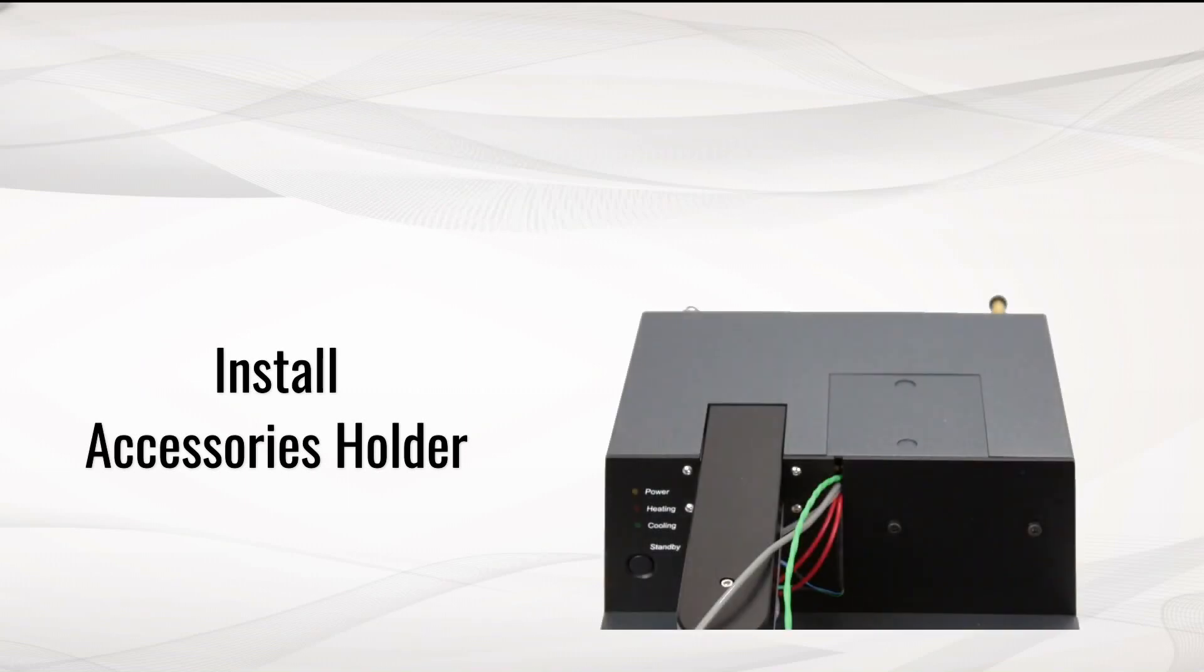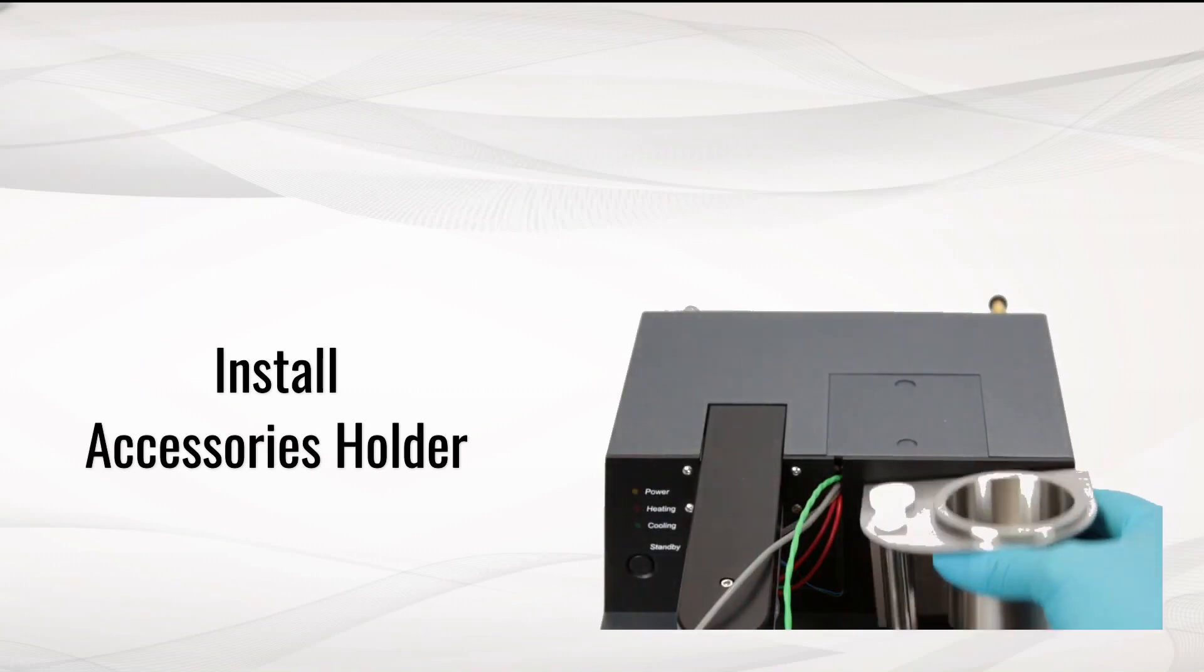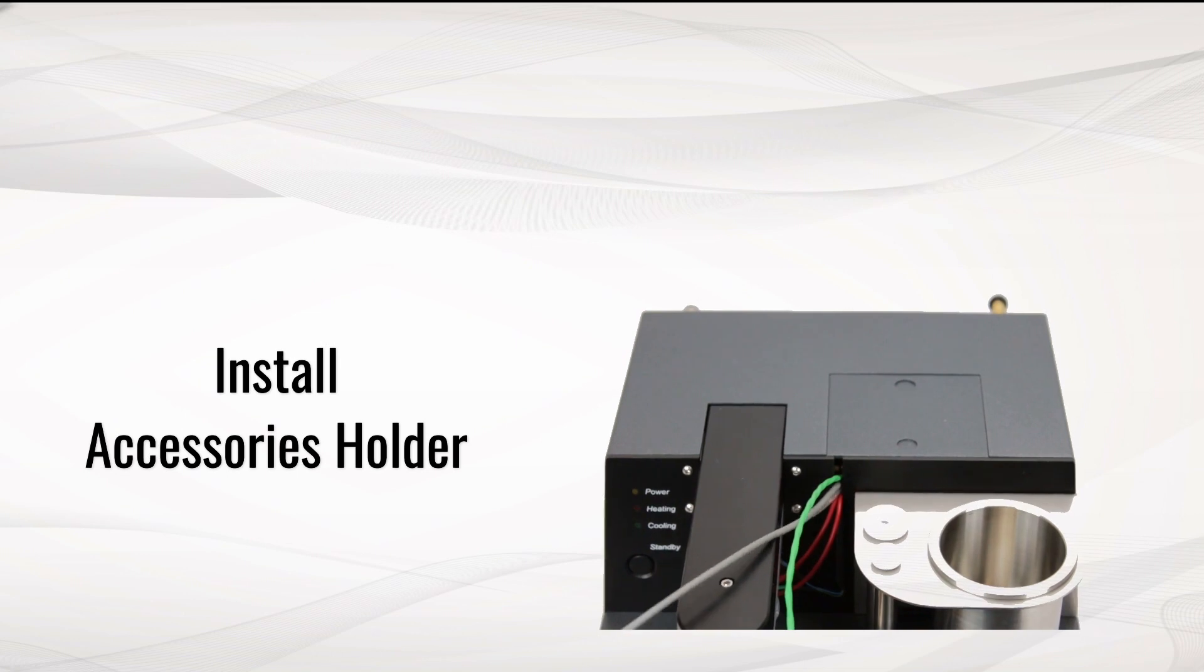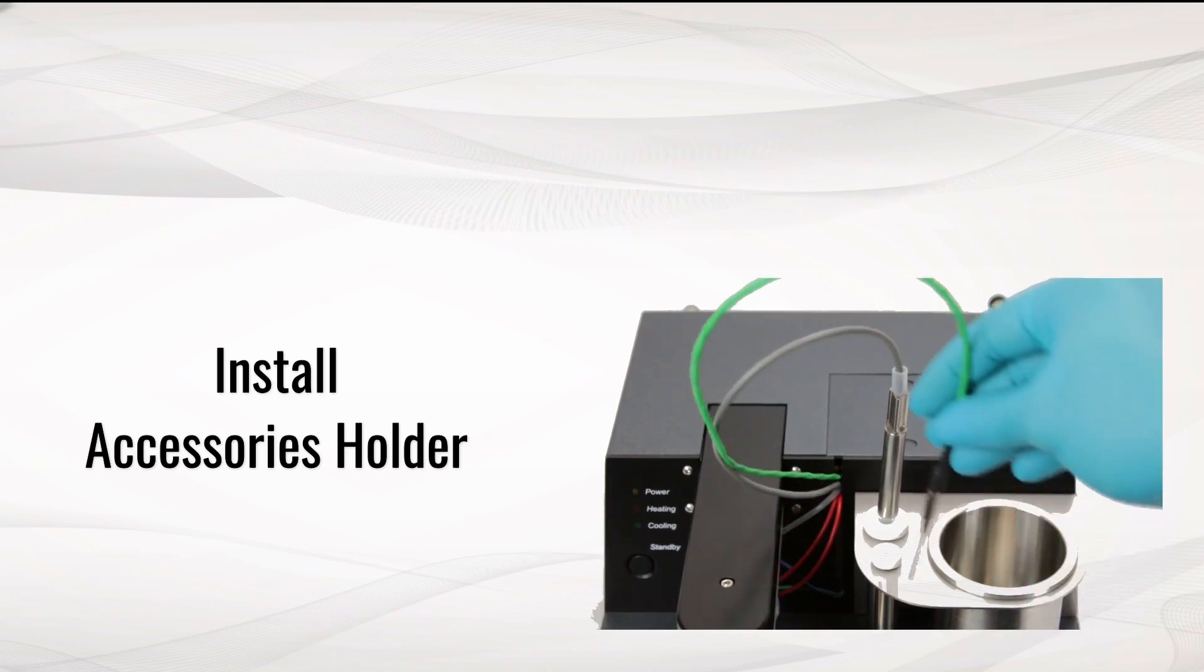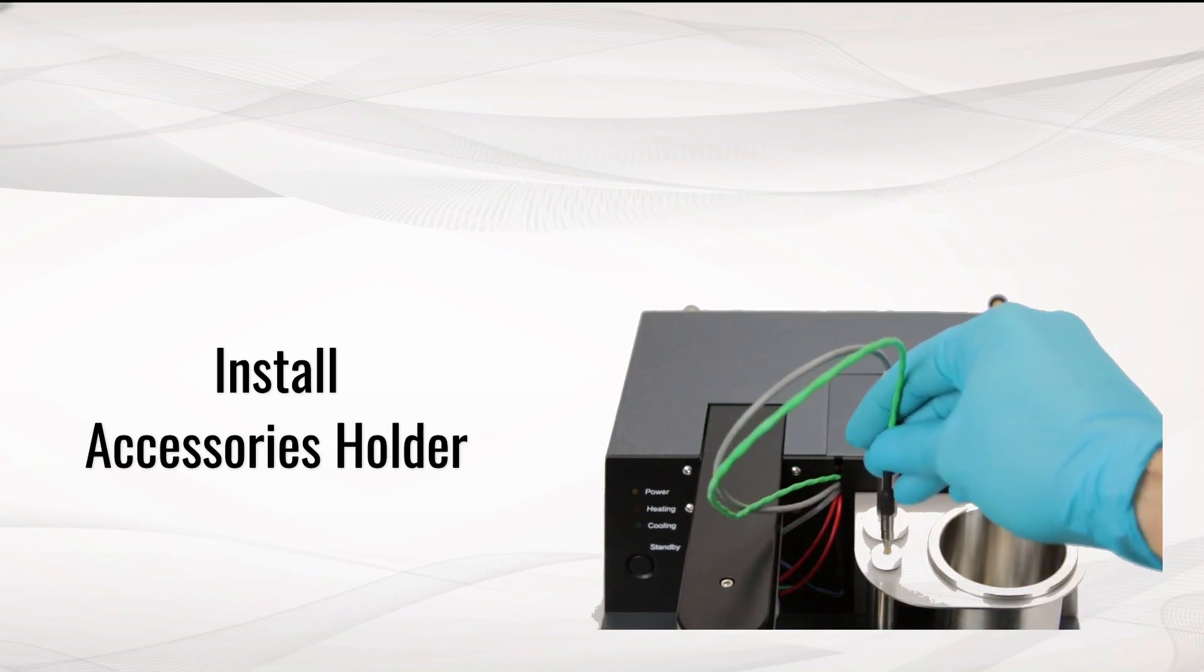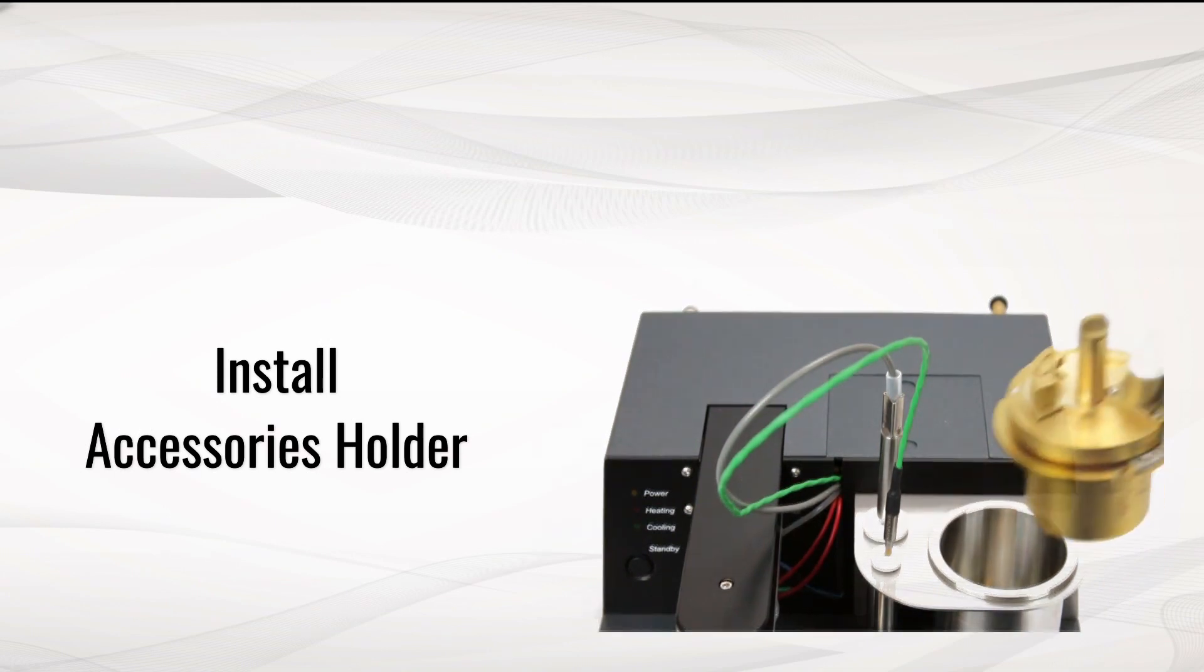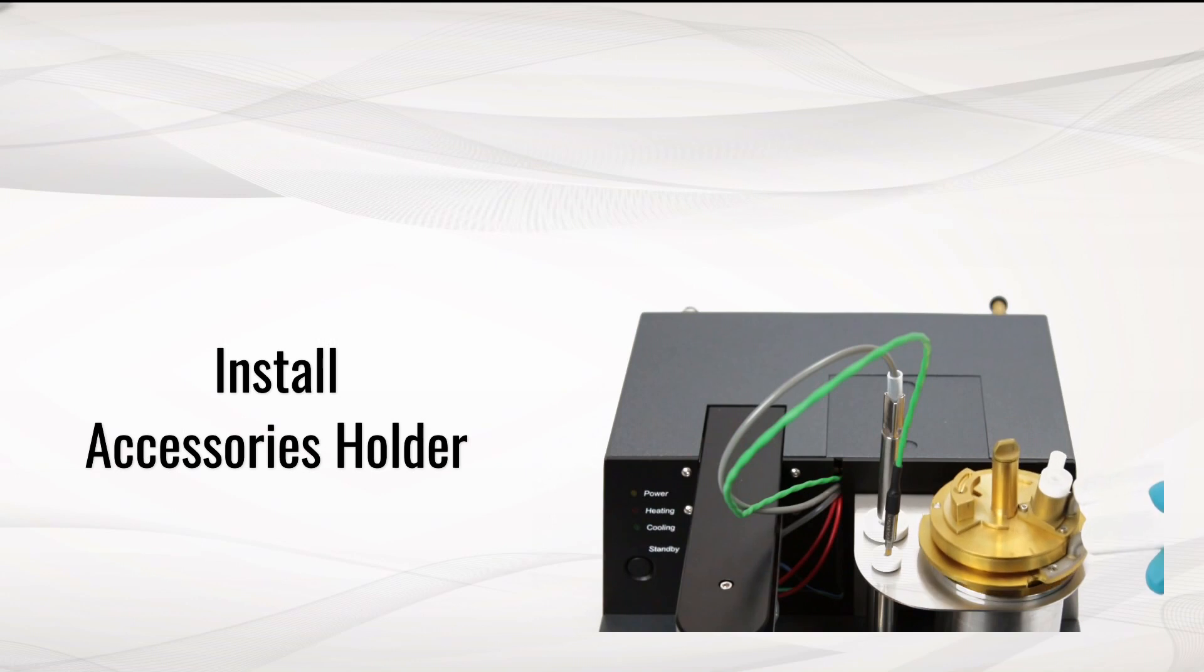Install the accessories holder and put the sample probe and detection thermocouple in the holding place. Install the cup and lid on the holder.